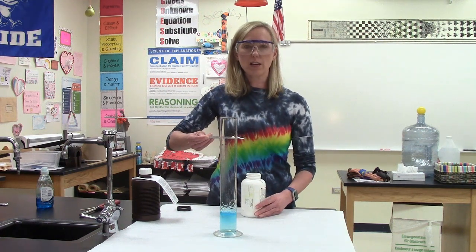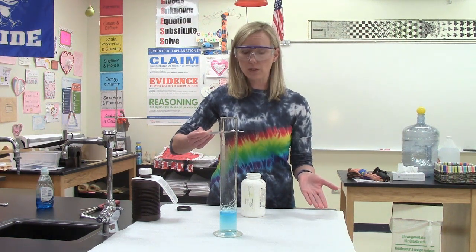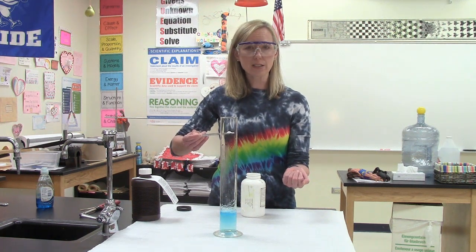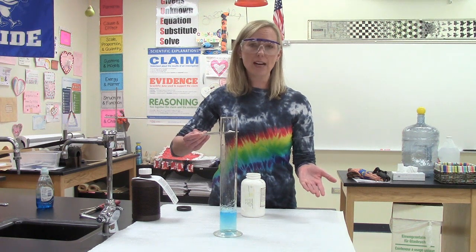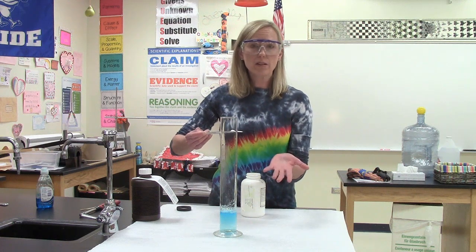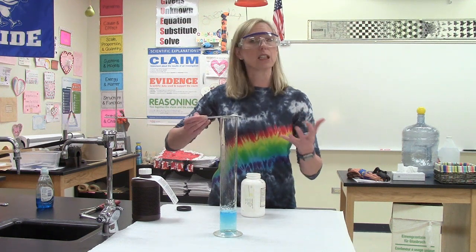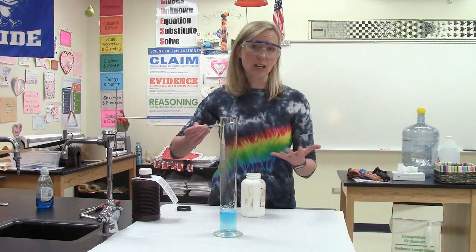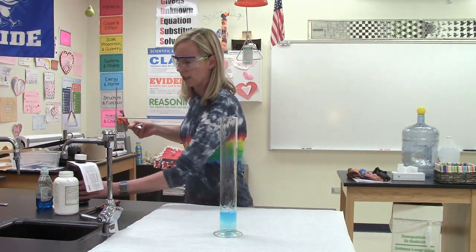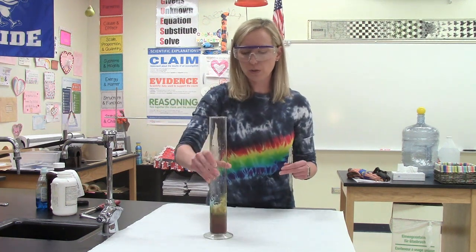One of the things that I'd also like to do, just to give you some evidence of a chemical reaction, and I've never tried this before but thought it would be fun to do. If one of our products is oxygen gas, I'm going to do a lit splint test. As you know, oxygen is a reactant that's necessary for burning. So if I bring a lit wooden splint near the oxygen that's being released, my hope is that we're going to see the lit splint get a little bit more fiery as the oxygen helps it burn. We'll see. So let me move some of my chemicals out of the way. Let's throw in our catalyst, and here we go. This is called elephant's toothpaste.